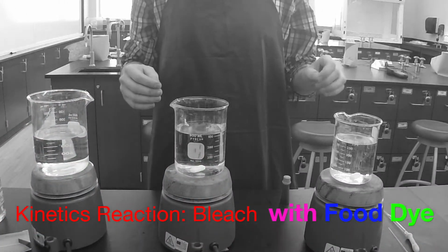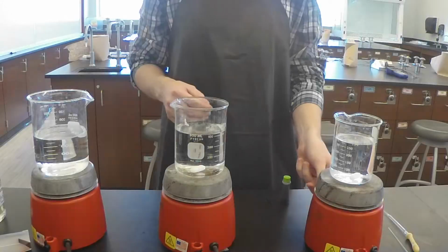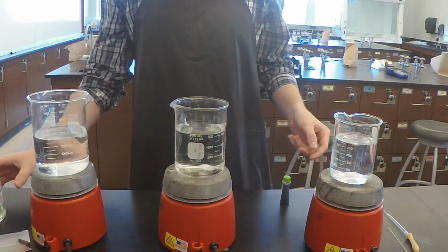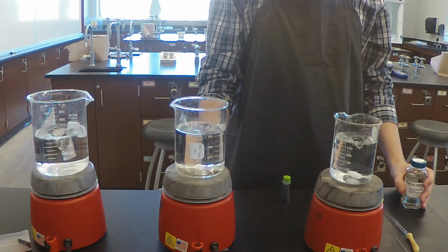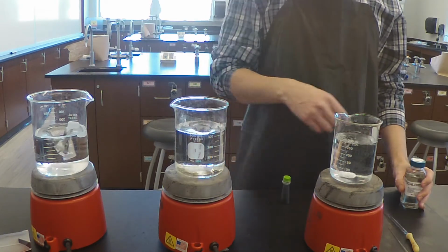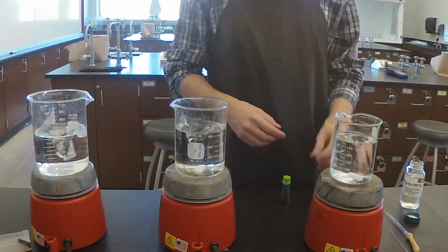Okay, so I have 3 beakers, to each of which I have added distilled water and a magnetic stir bar in order to improve the reaction with the bleach and food dye. To the first 2 beakers, I will be adding blue food dye with a varying concentration in order to observe how the bleach reacts with it differently. Then to the third beaker, I will add green food dye, and we can observe how it reacts differently from the first 2.